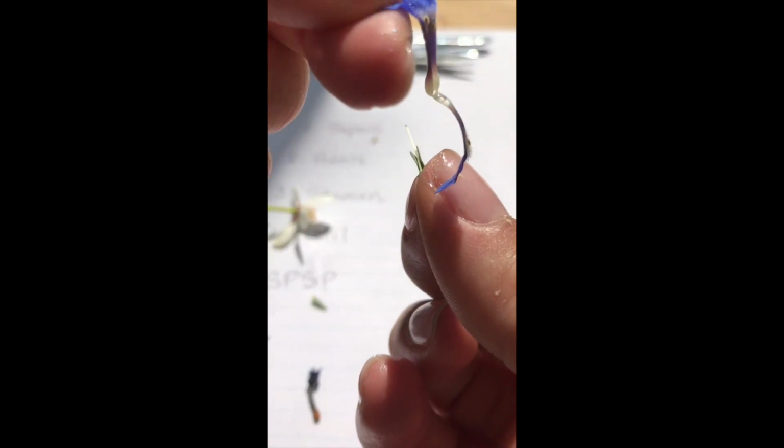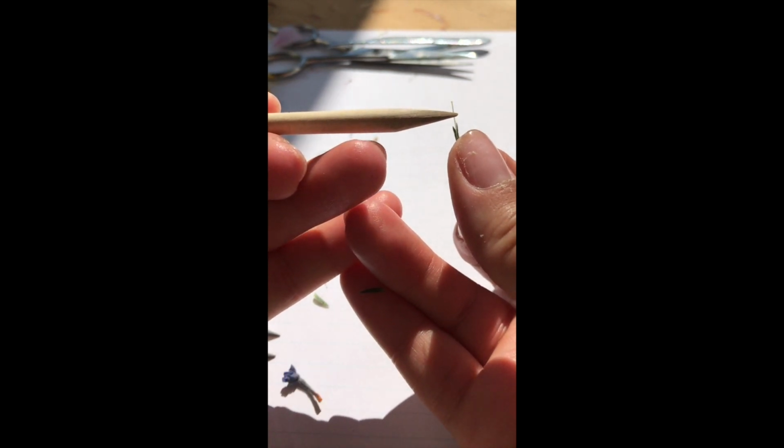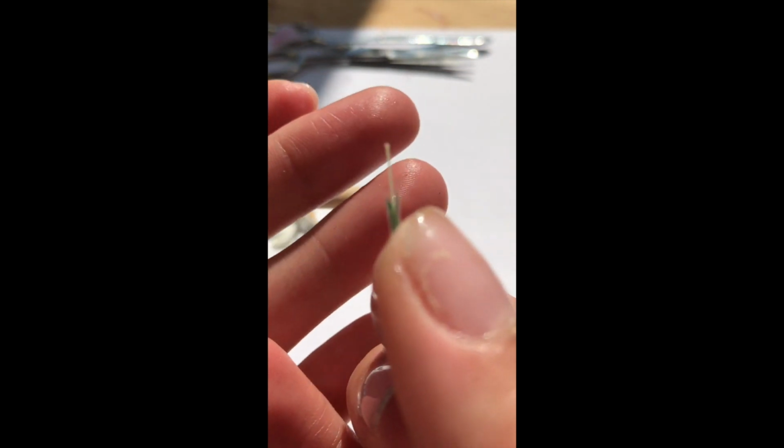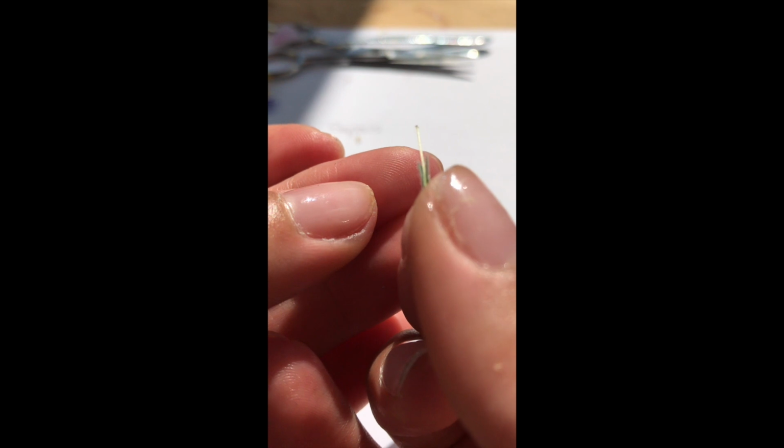And if we're wondering where that pistil is, the last part, remember that we slid these petals off of the sepals. Remember, we actually just pulled this whole tube off. So this last little lone piece sticking out right here is a very, very tiny pistil. And there is a very, very tiny mushroom top on the top of that one too.